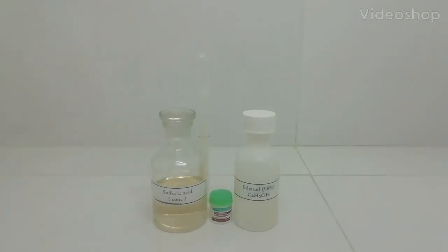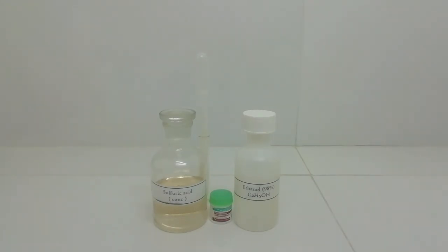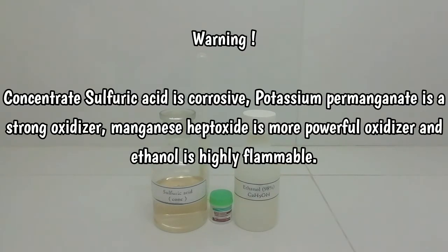In this video, I am going to perform the popular thunderstorm reaction. So, we need sulfuric acid, potassium permanganate and ethanol. You must care about this warning because sulfuric acid is very corrosive, potassium permanganate is a strong oxidizer and ethanol is highly flammable. In this case, I am using 98% ethanol.